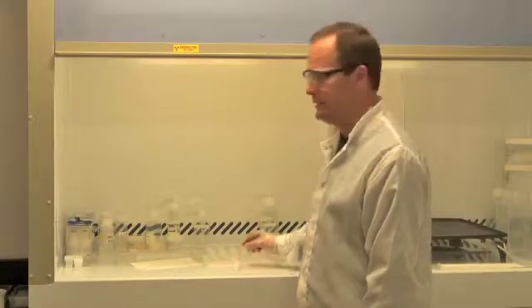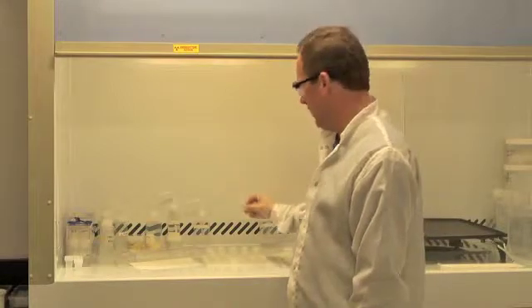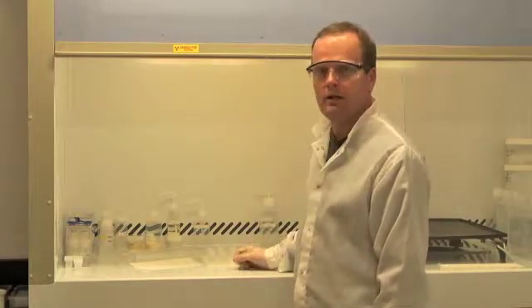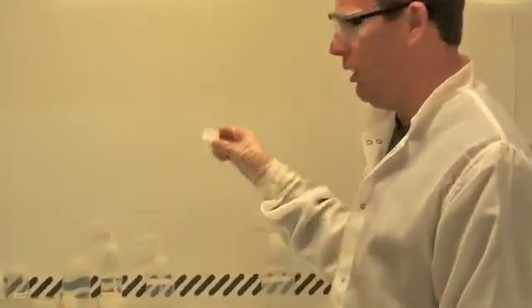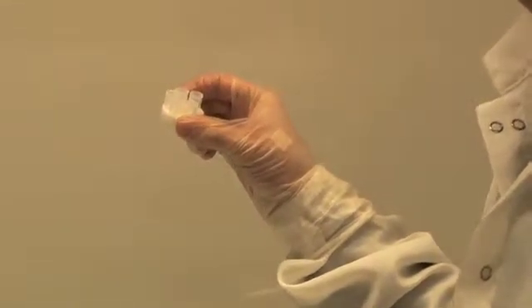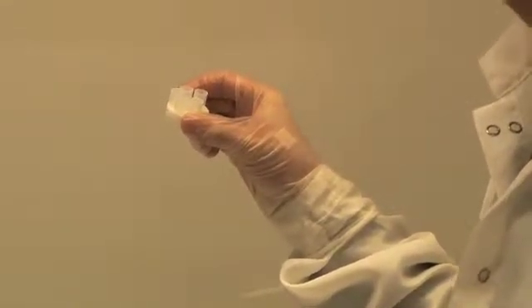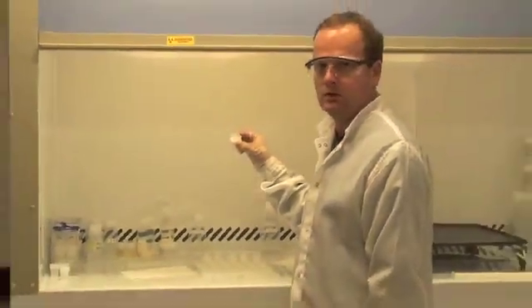I've finished loading my zircons into these small teflon beakers. I've now brought them into the clean lab, and we're ready to load each zircon into a small teflon microcapsule. Each one of these capsules will contain one zircon crystal. This is the container that we will do the chemical abrasion in, and then ultimately dissolve the residual crystal.